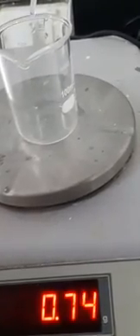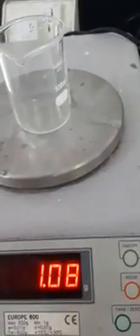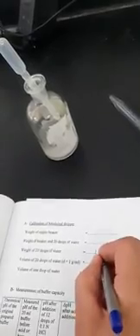Now we will add 20 drops of water — 1, 2, 3, 4, 5, 6, 7, 8, 9, 10, 11, 12, 13, 14, 15, 16, 17, 18, 19, 20. I will take the weight of 20 drops of water, which is around 1.1 grams. I will record this in the blank: 1.1 gram — this is the weight of 20 drops.